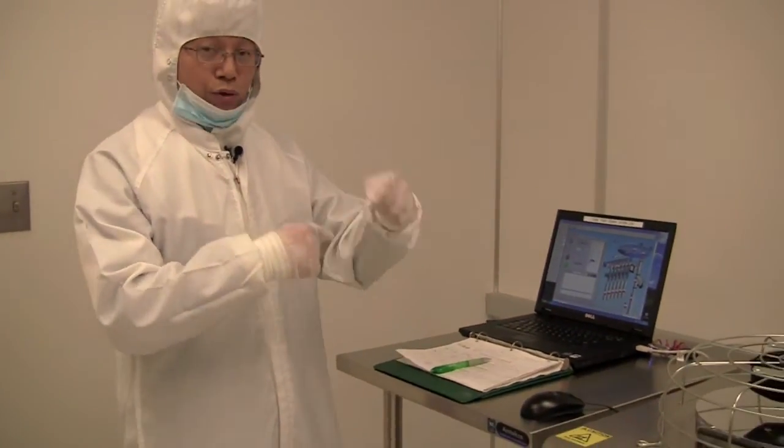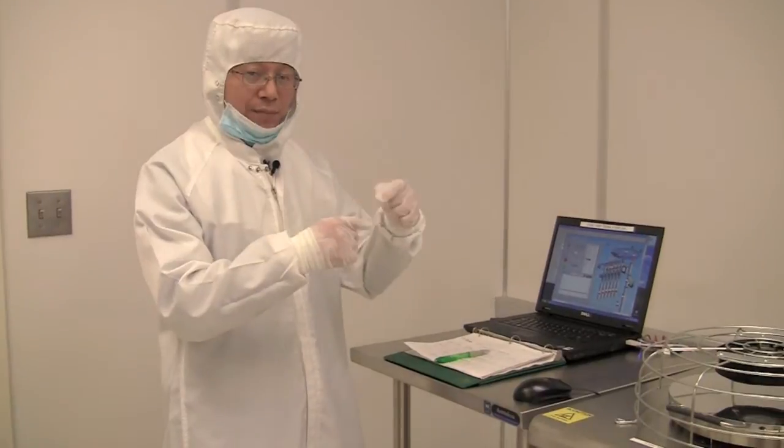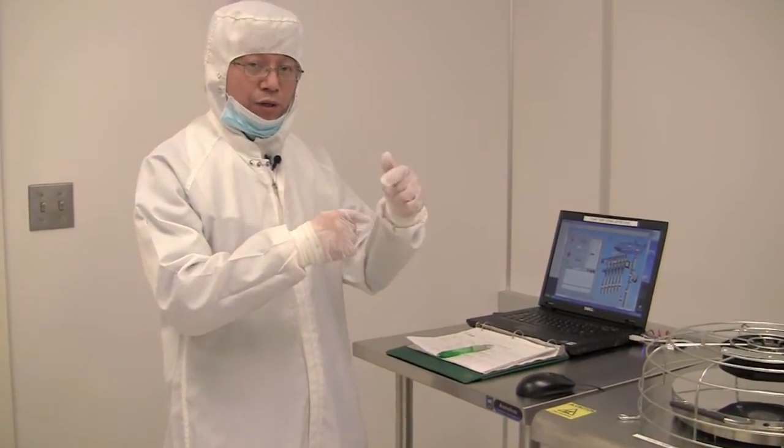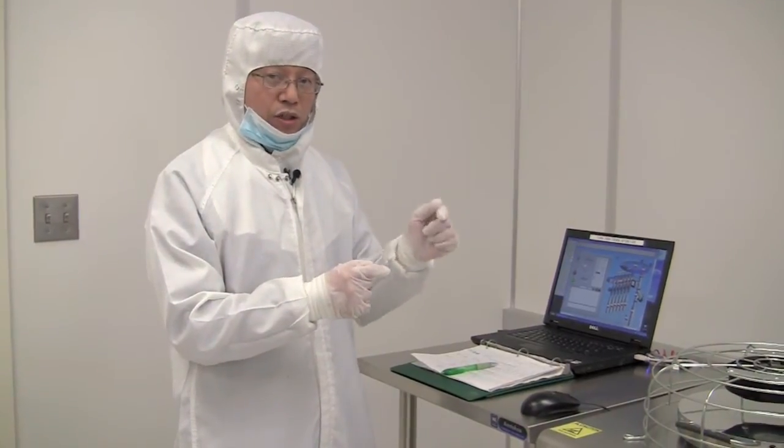By doing this again and again many times, really depending on the number you set in the recipe. After that, the process stops.